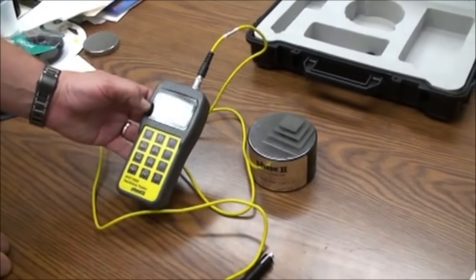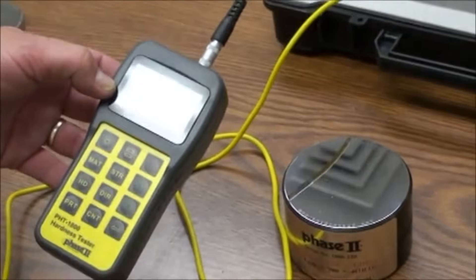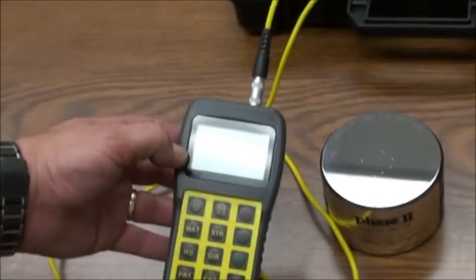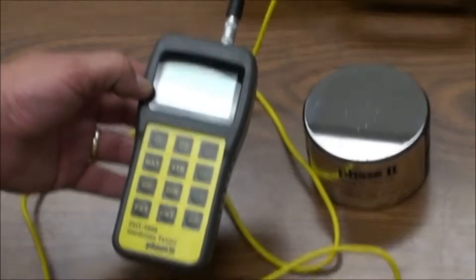On the keypad, hit the power button to bring up your test screen. The main interface screen should be displayed.